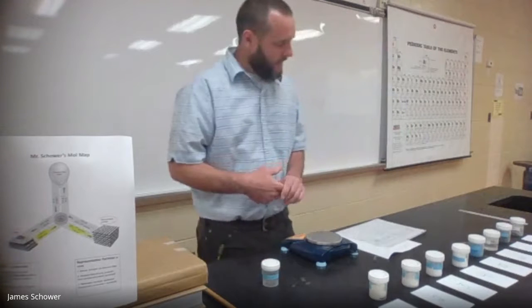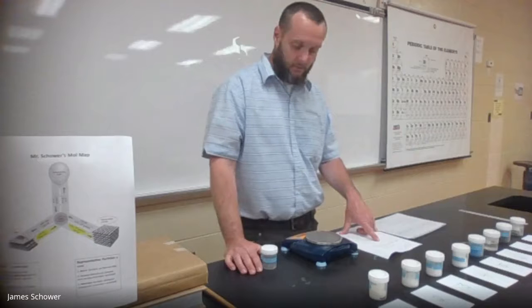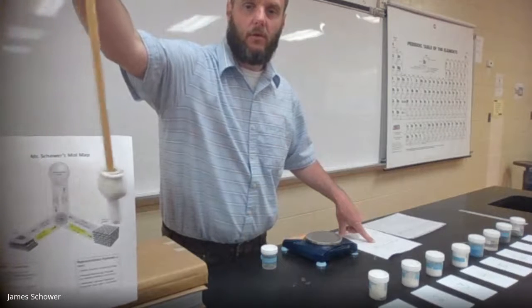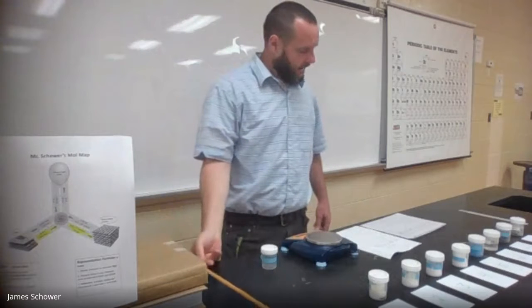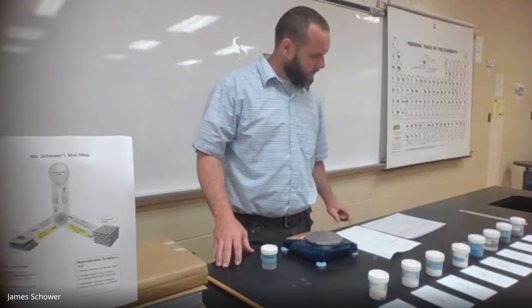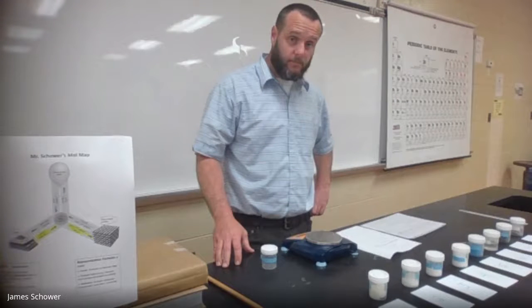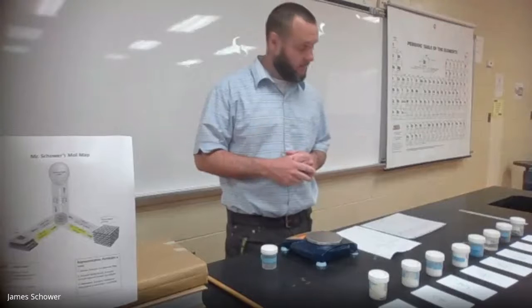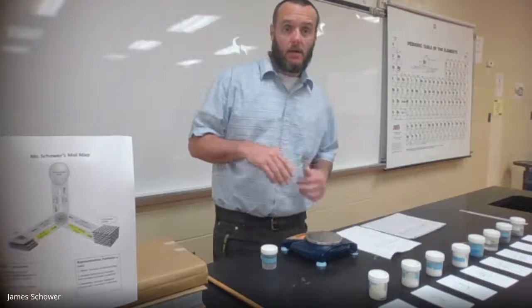What you have to do is take the mass of sample and bottle and subtract the mass of the empty bottle, which is 14.52, and that gives you the mass of substance. Convert all the way to representative particles using those two conversion factors, and make sure you label it correctly. Round everything to two decimal points for significant figures. Make sure your formulas are correctly criss-crossed; otherwise you won't get the right molar mass. Molar mass is a column I want to check, so I'll go check all your molar masses.